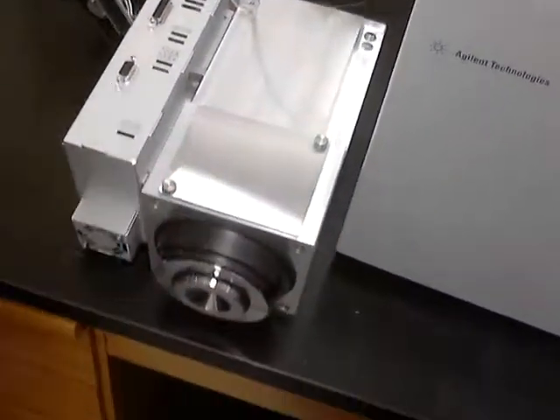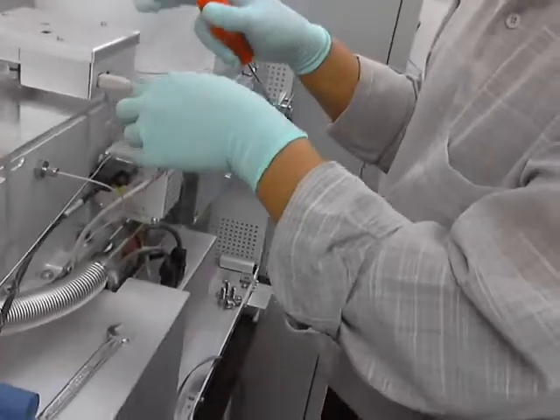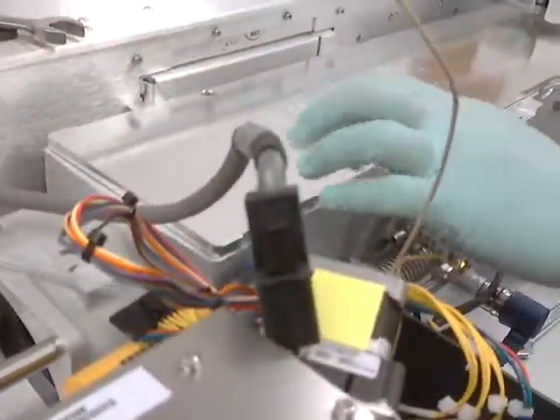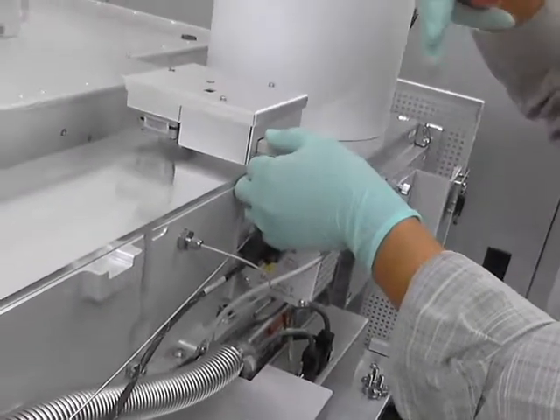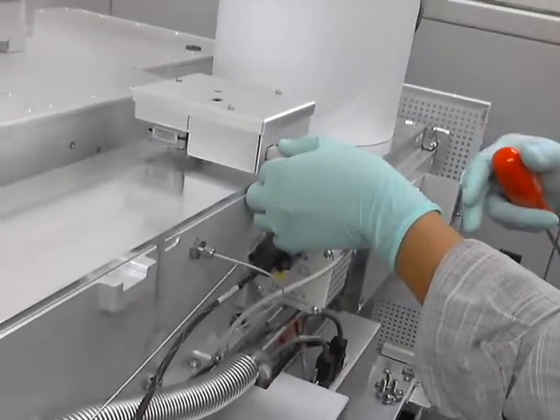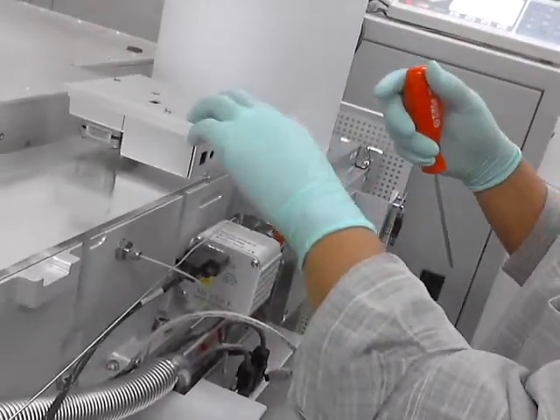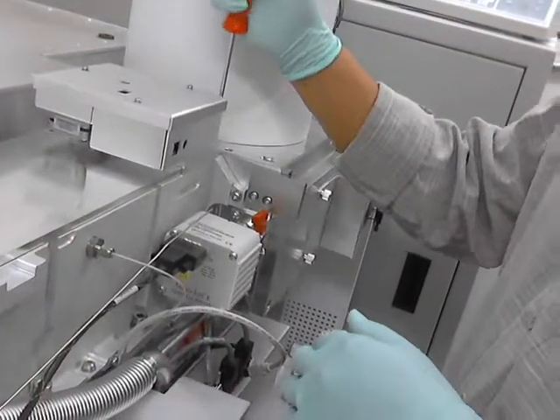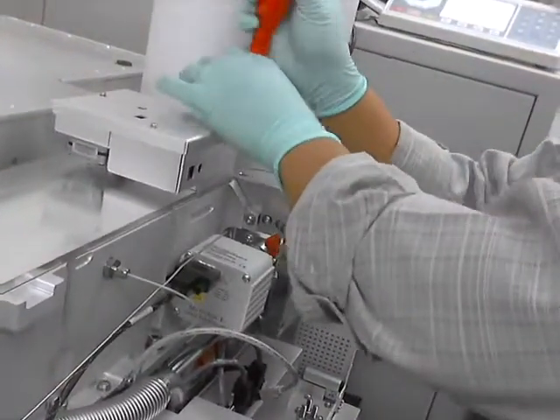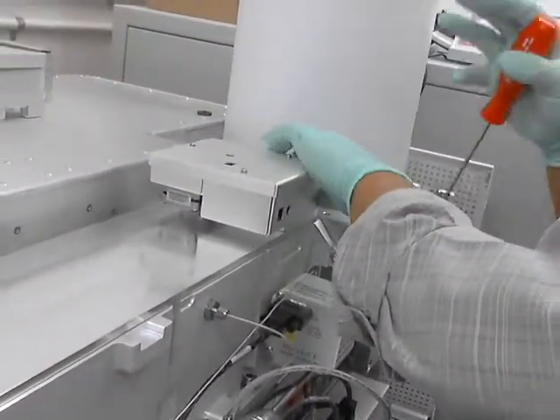We're not going to do a whole lot with these ones. This is the one that I really want to come off. This whole top comes off also. This is the one that controls the slicer positioning — it's easy to forget this one. If you turn it on and this errors, the slicer positioning errors out.